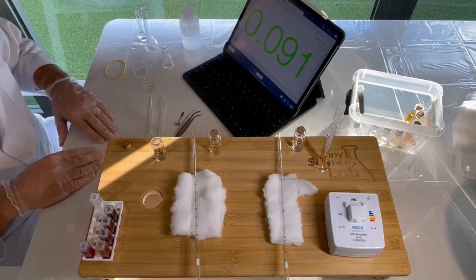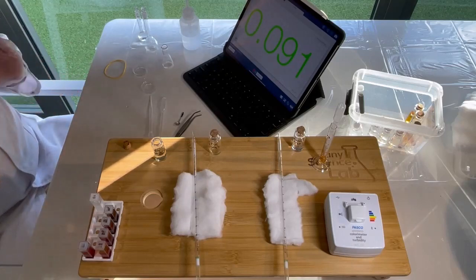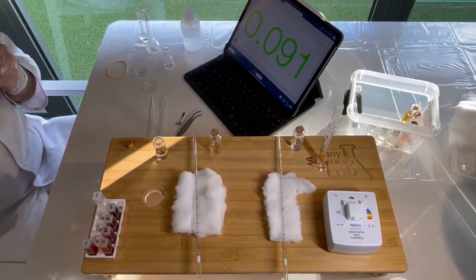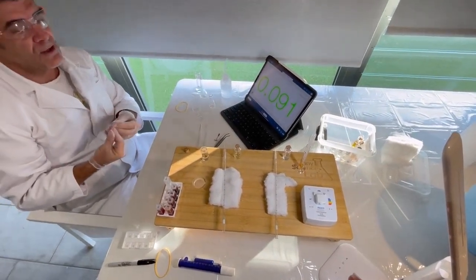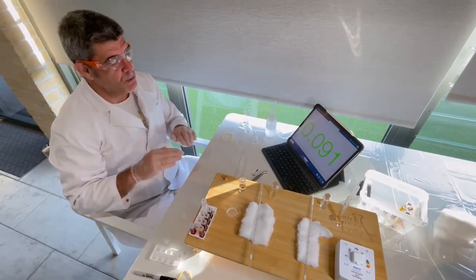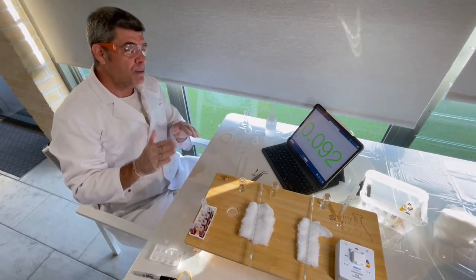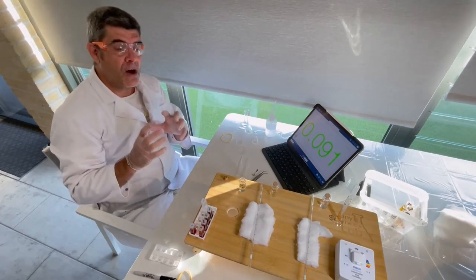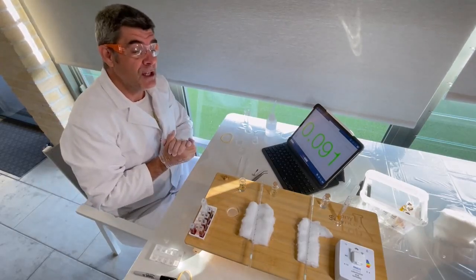And you can see now that we've got a value of 0.091. So it's a much lower absorbance, and we would expect that because the concentration of ions is much lower, and therefore not as many ions will be available to absorb the green wavelength of light, the 550 nanometer wavelengths of green light. And so as a result, we've got a much lower value, and that means that we're able to now use our calibration line to work out what the actual concentration of iron thiocyanate ions are in this solution. And from there, we can calculate the equilibrium constant.